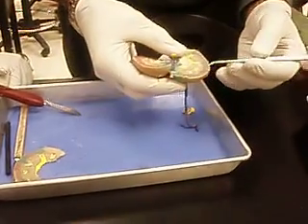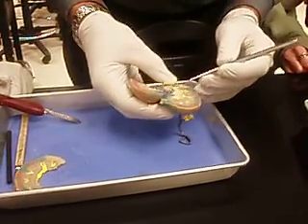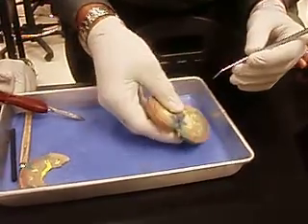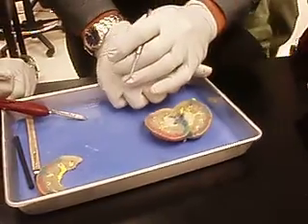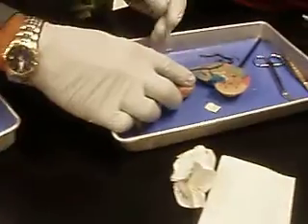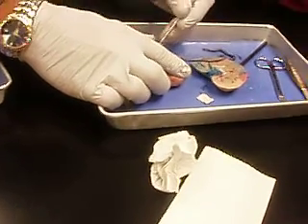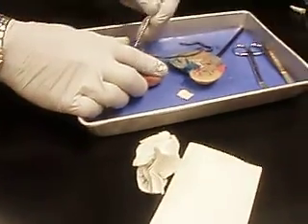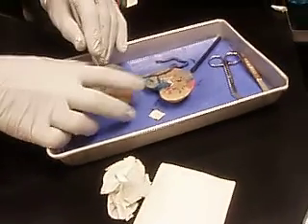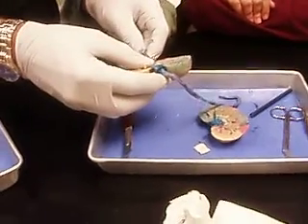You can see the interlobular arteries and veins. You can see a very nice papilla coming down here, draining into its minor calyx back here. It's going to head out. Ours is a lot worse. But they took the capsule off. Darn it. Well, no, as a matter of fact, I kind of like yours because you can see how this minor calyx would have been right here, where this papilla ends up right here. This is then draining into the hilus, which goes to the ureter.